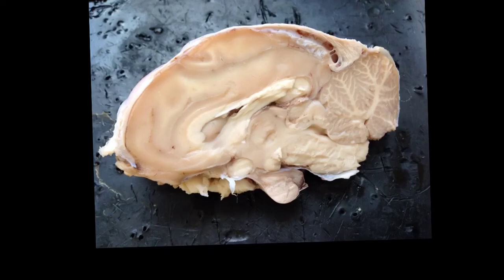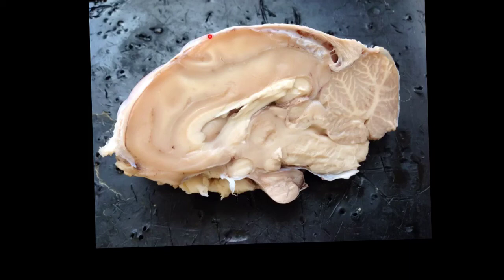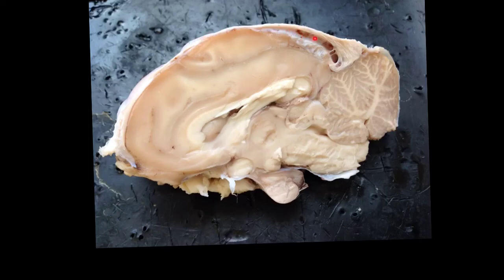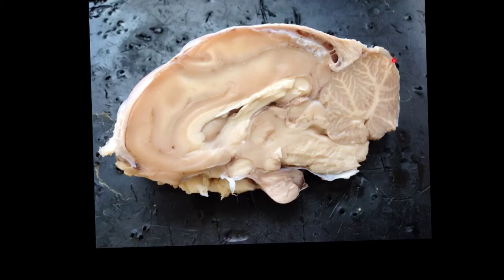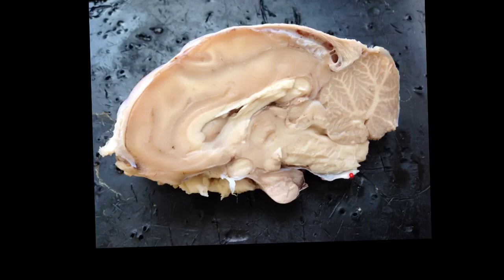I'll point out a few other things. In this dissection, you can see this nice light connective tissue around the outside — that thick external layer is called the dura mater. You can see it with a little pocket beneath it right here.